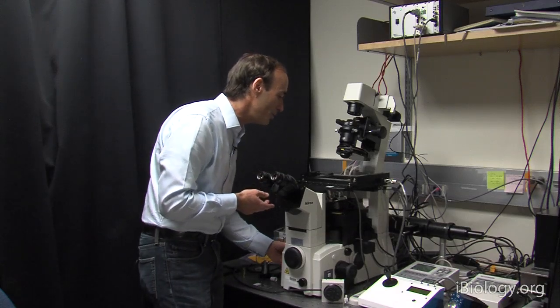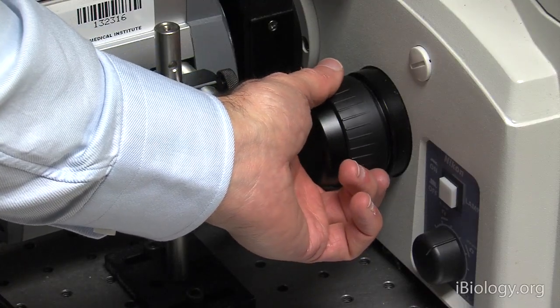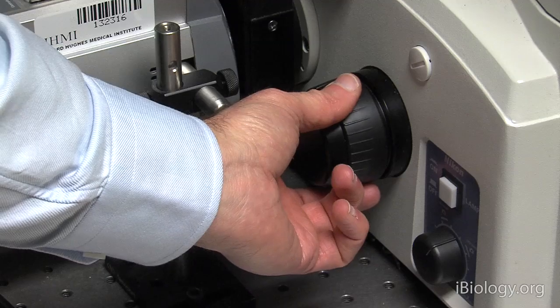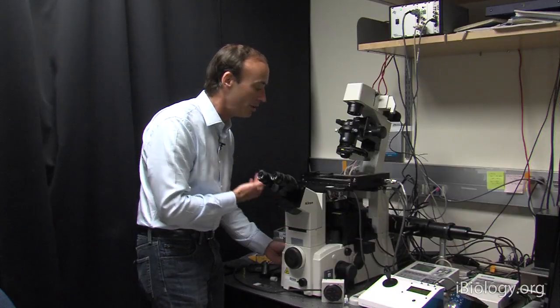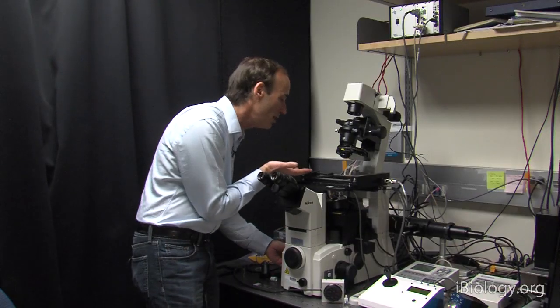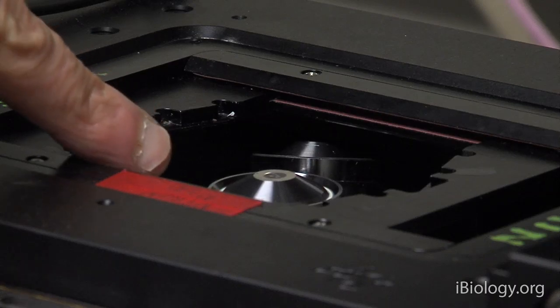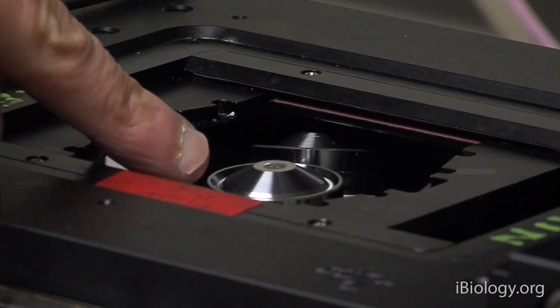In this case, I'm turning the focusing knob in both directions, and I can see that when I turn the focusing knob towards me, the objective lens is rising up towards the specimen.